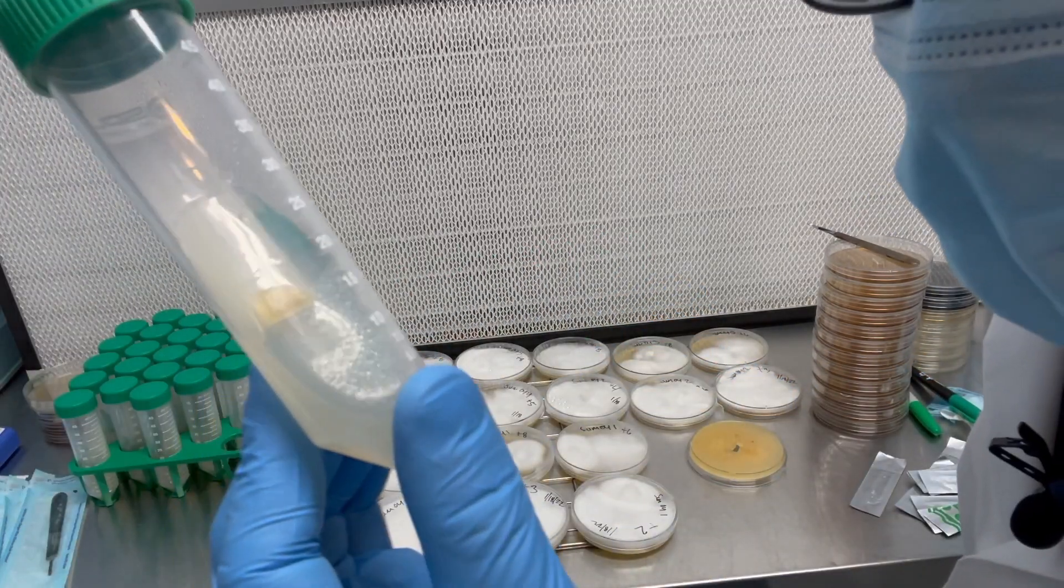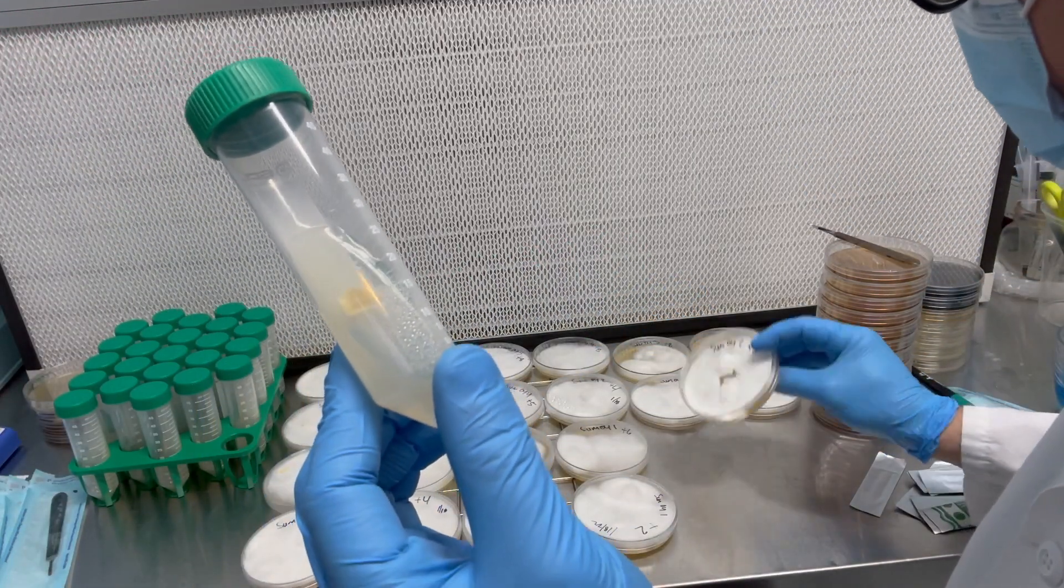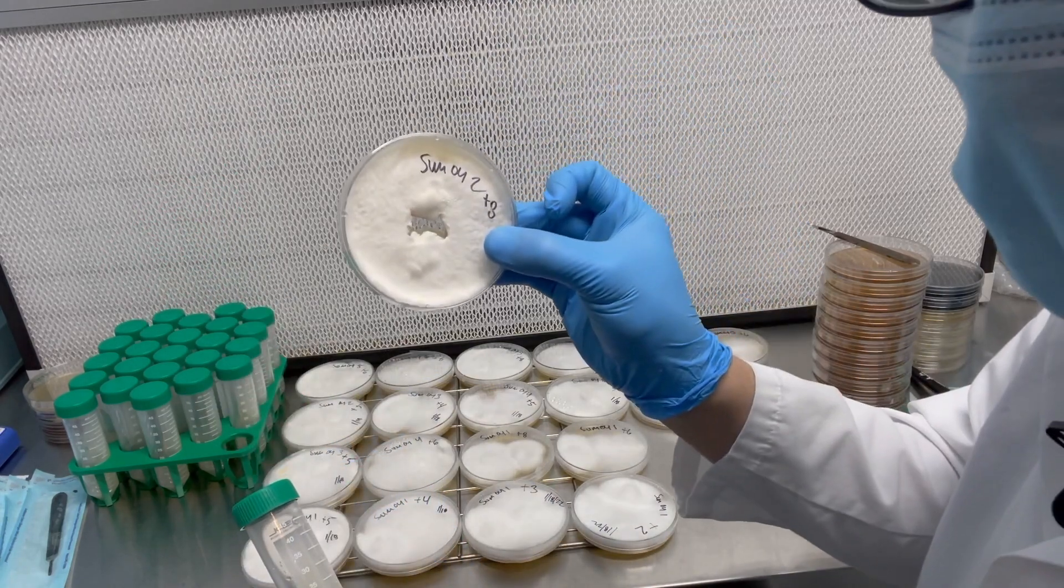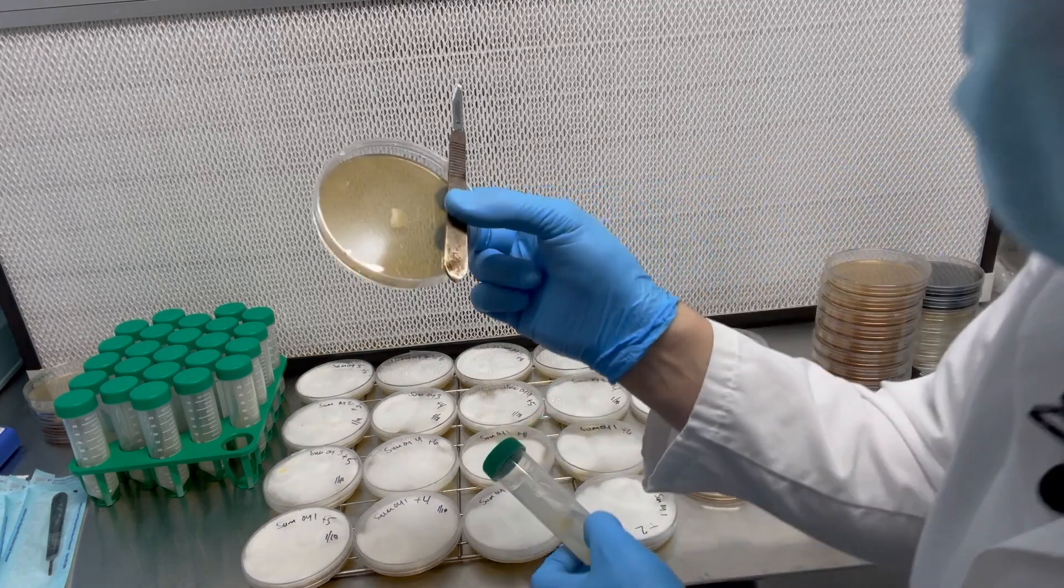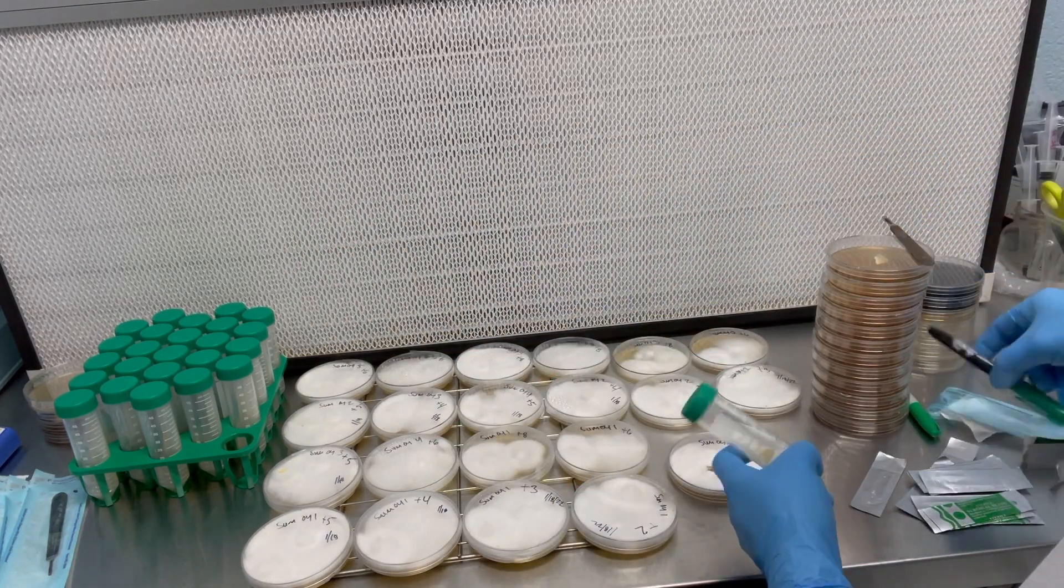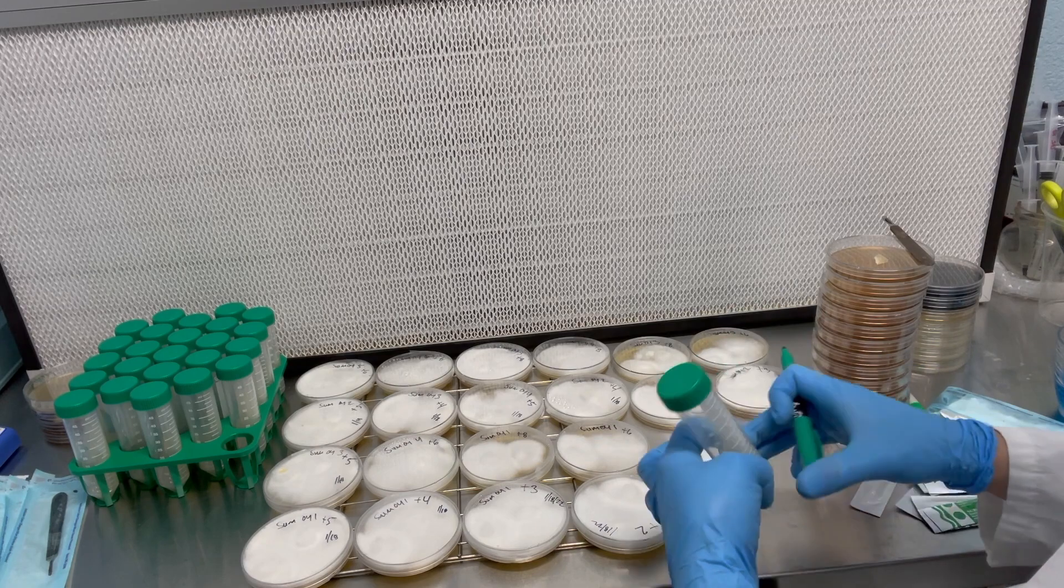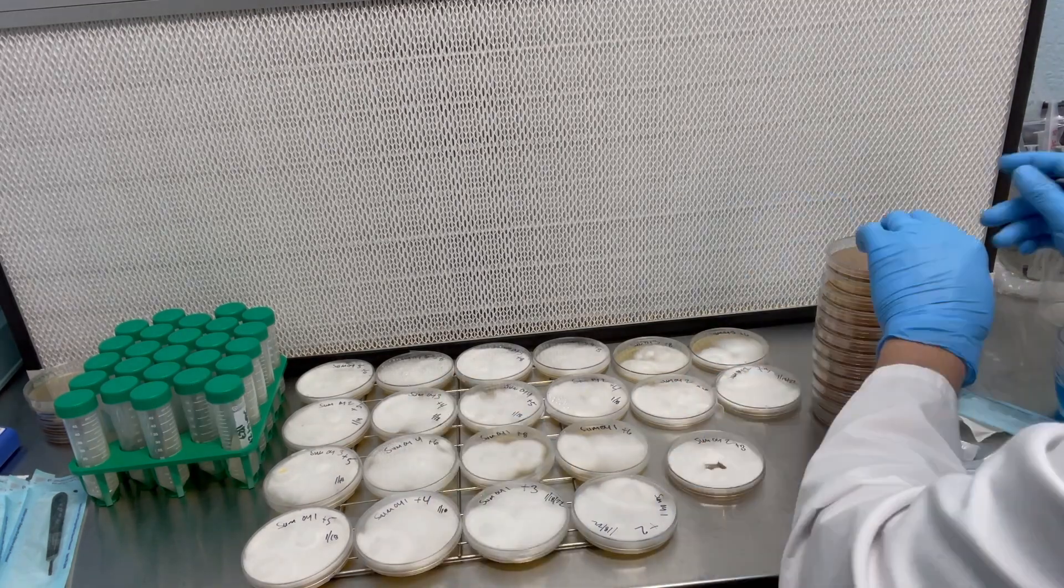All right so there you have it, we've got our slant, our mated culture, and then this is what will be used for production.